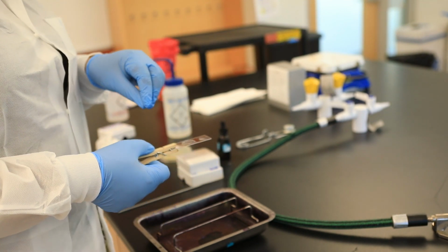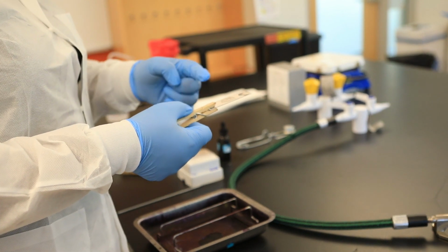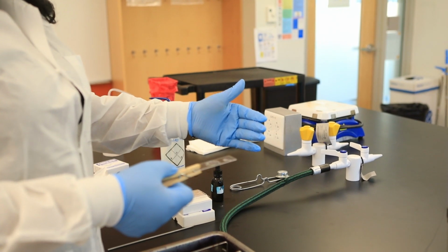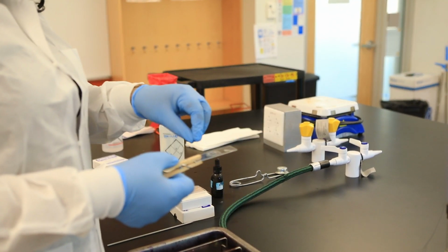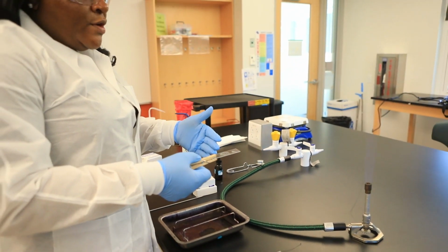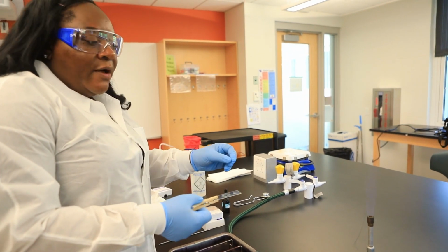This is very, very important in staining, because the worst thing to have happen is if you start adding your reagents and your cells start sliding off and there's nothing to stain. So this allows for the preservation of the bacteria onto the slide so that when you start adding the reagents, your bacterial cells are still there. Nothing has slid off, okay?